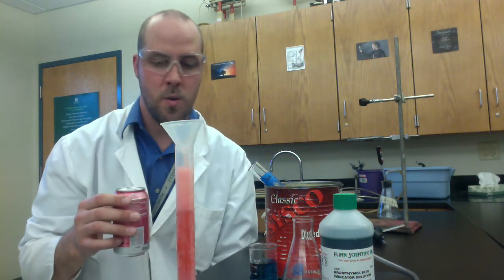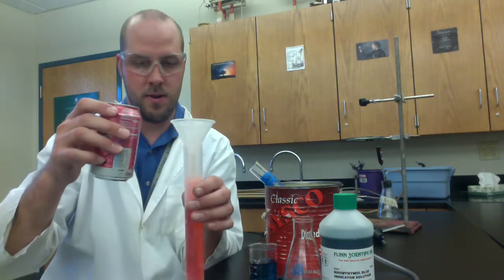Me practicing right now, I'm trying to decide if I want you guys to do 100 or 200 milliliters. Last year we did 100. I'm going to try 200 milliliters and I'll let you know next week which one we are going to end up doing in our lab.